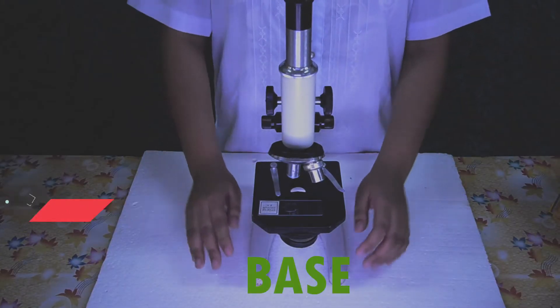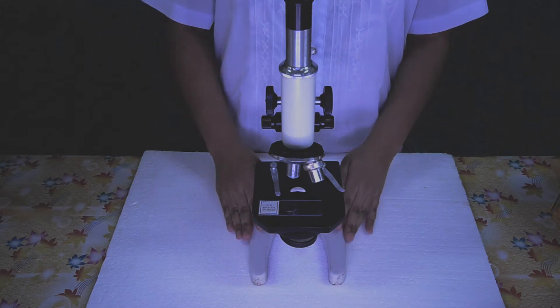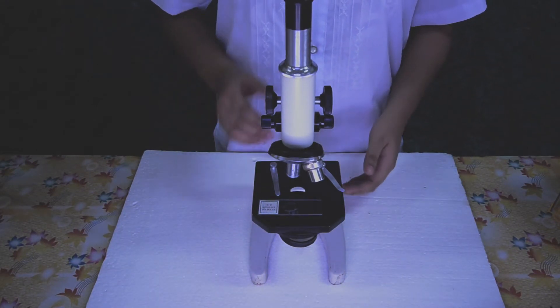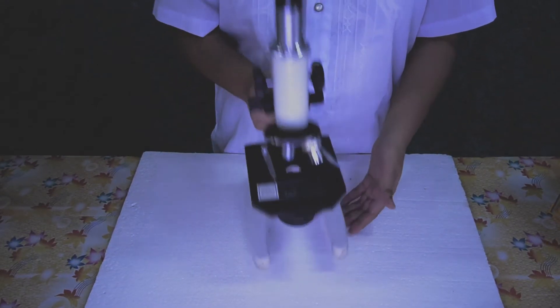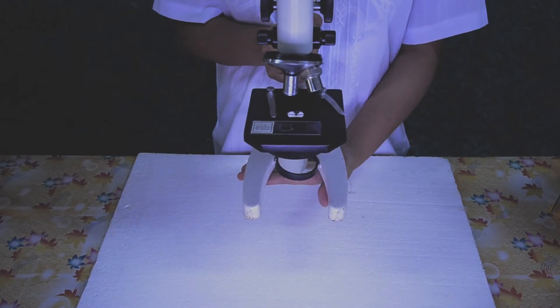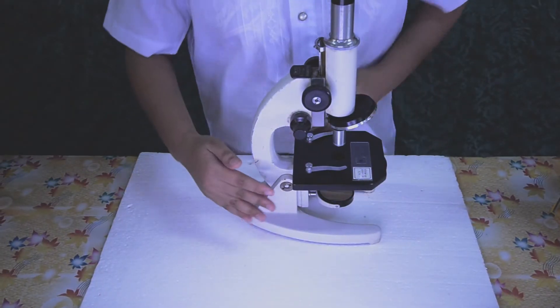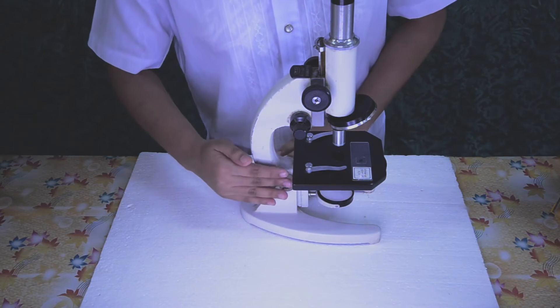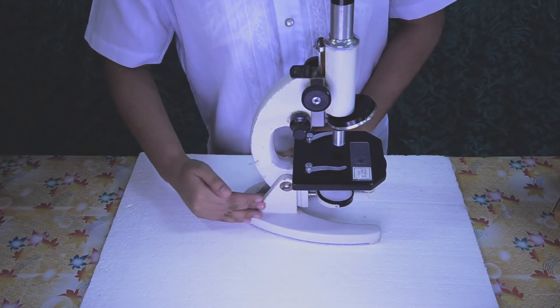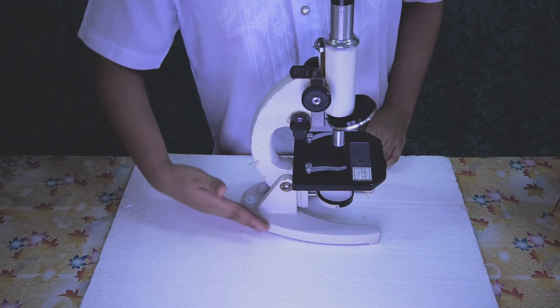Base. It is the basal, horse-shoe-shaped structure. It provides support to all the remaining parts of the microscope. Pillar. A small, strong, vertical projection developing on the foot or base.